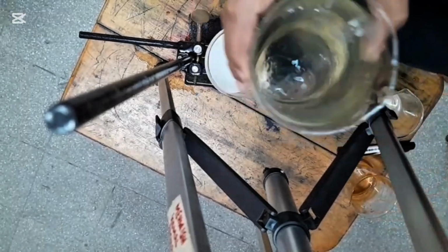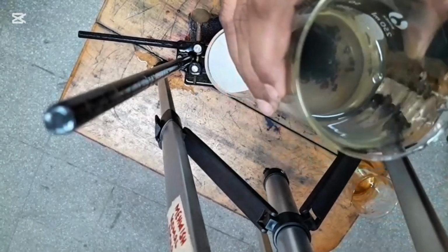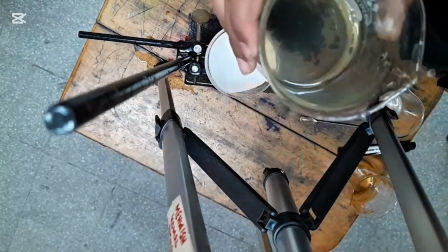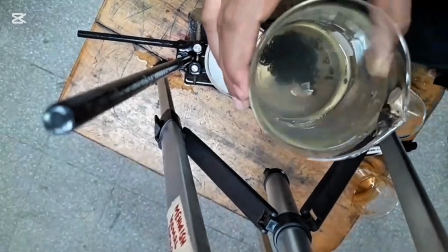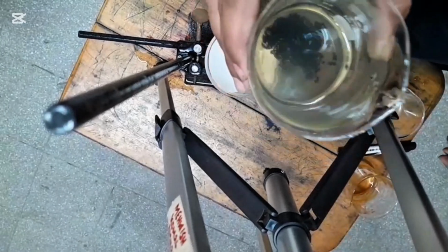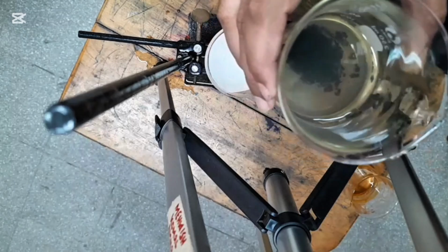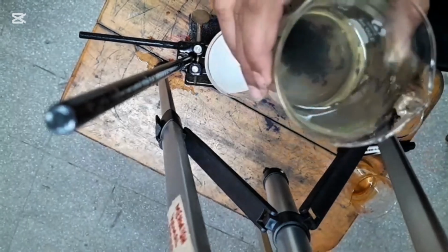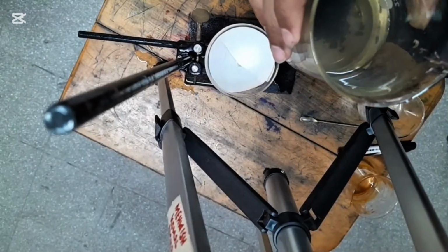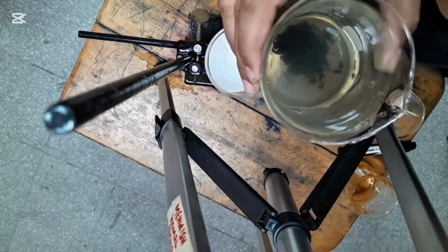By mixing this, you can see that the particles of sand are not getting mixed with the water. When I filter this, we will do the filtration of this just as we did the filtration of the solution. You can see that the sand particles will be left as residue on the filter paper. Okay, so we are starting the filtration process of this suspension.